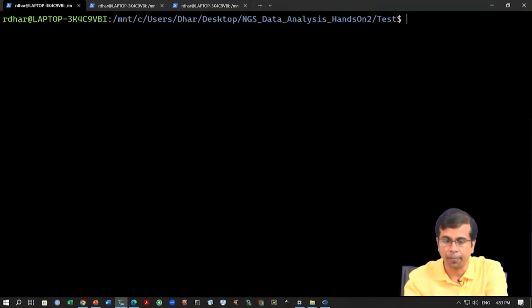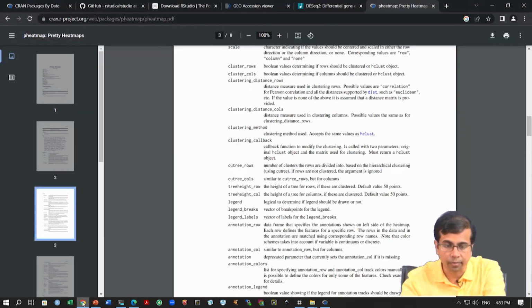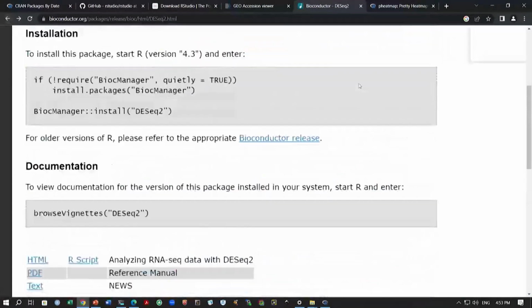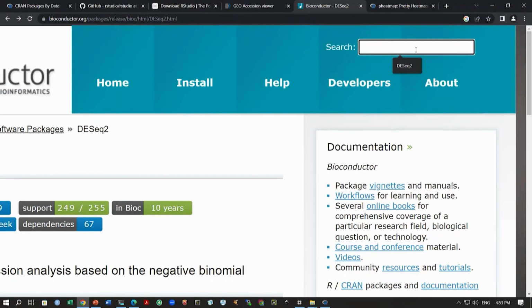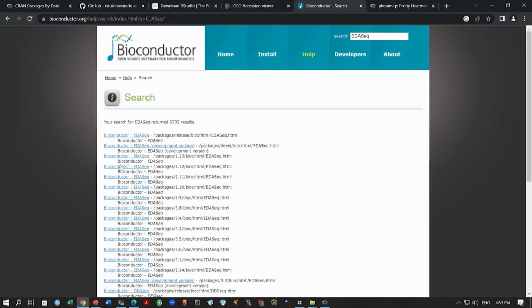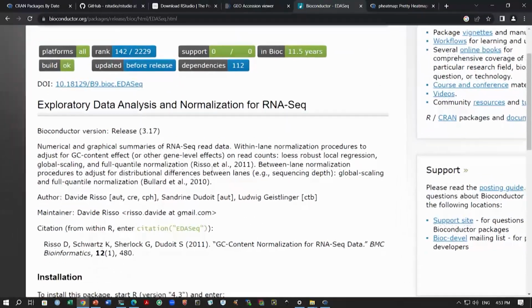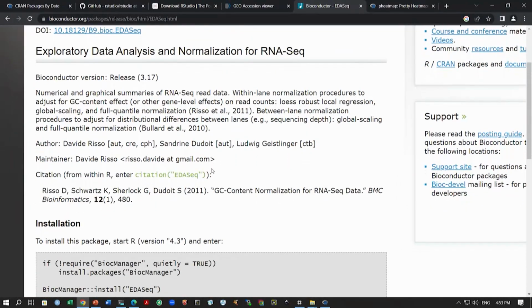So again, I'll show you how this package looks. This is a part of Bioconductor, so we can simply search here. You can see this first result, Bioconductor EDASeq. We have talked about this very briefly in the theory class. Here it can adjust for GC content and gene-level effects on read counts. It can do different types of methods, at least three methods.